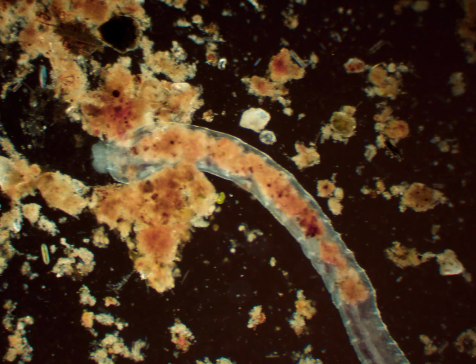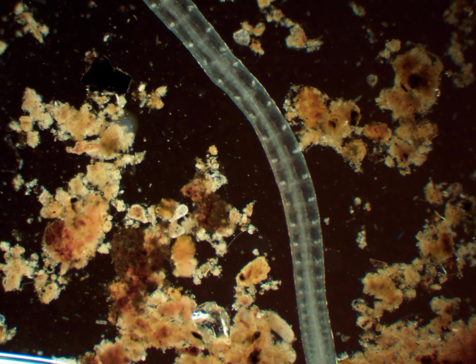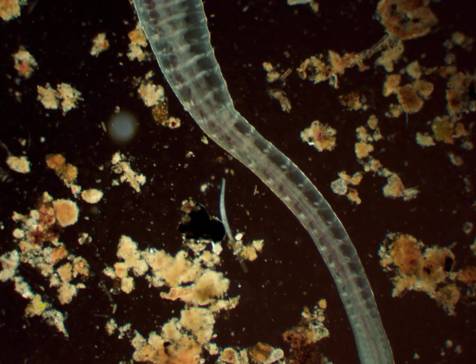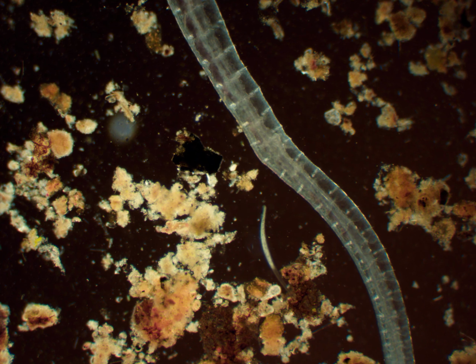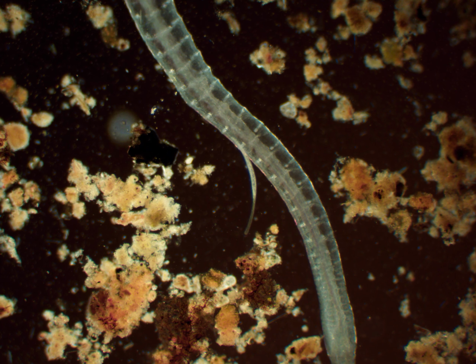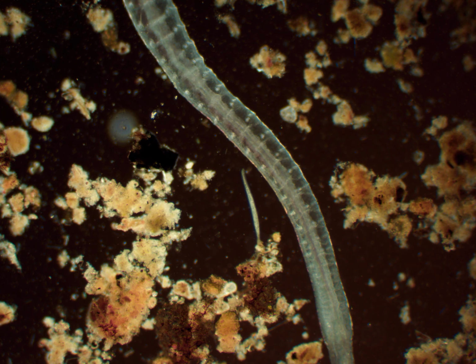This one is microscopic but still large, since this is with my 4x objective. You can see all of its segments moving and the worm moving. It moves similar to an earthworm with its segments, since an earthworm is also an annelid worm. And that white thing you see, that is a spirostomum.